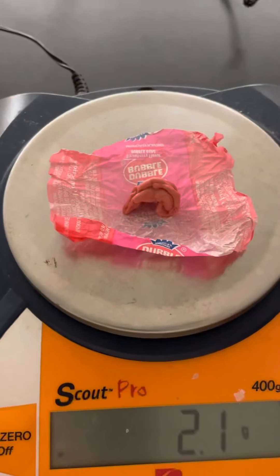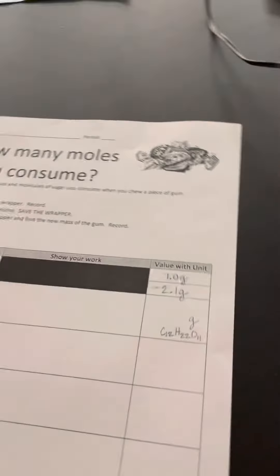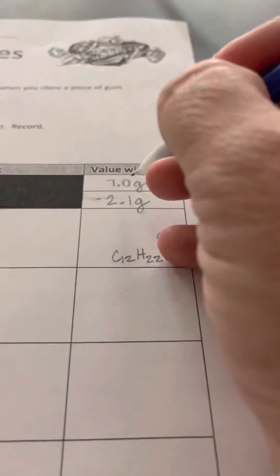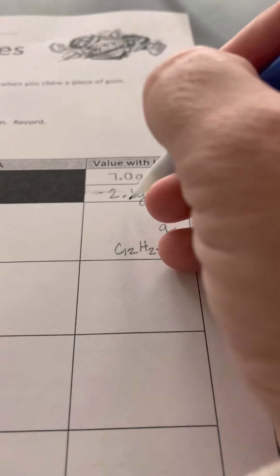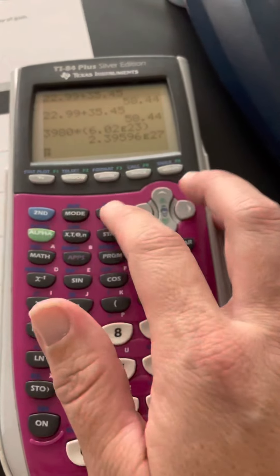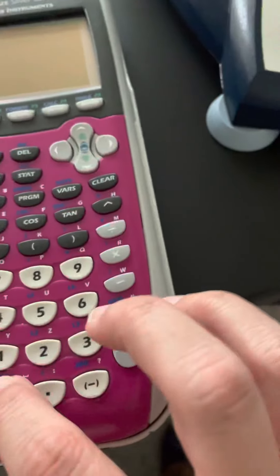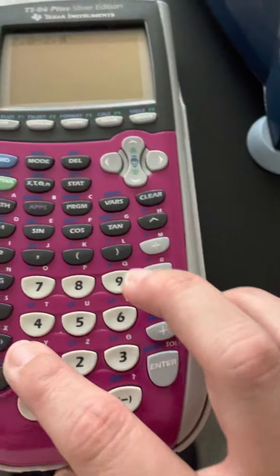You can do whatever you want with your gum when you're done — I am going to throw mine away. So now that I have my initial mass and my final mass, I'm going to calculate the difference between them with my handy dandy calculator. Super hard math: 7.0 minus 2.1 gives me 4.9 grams.